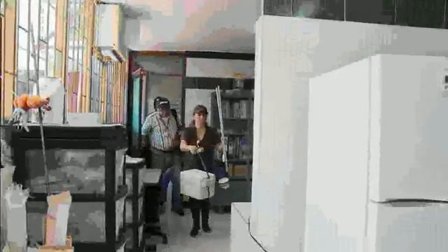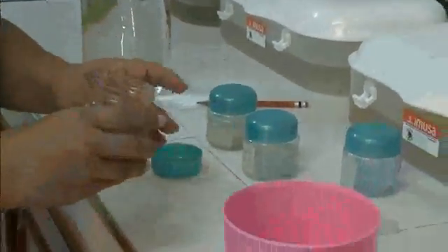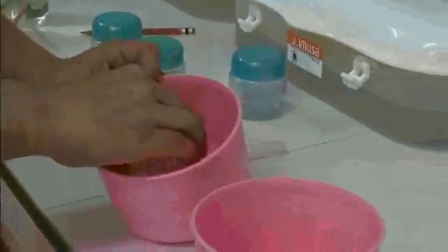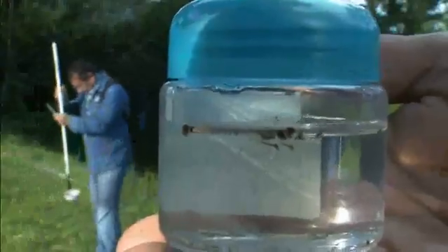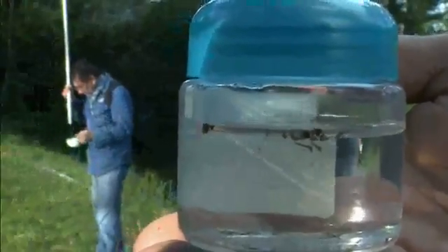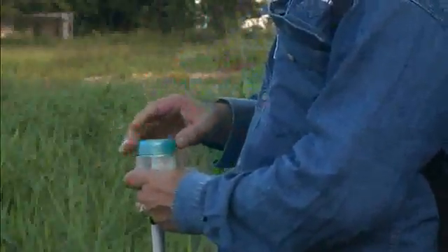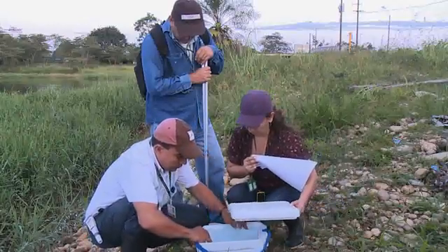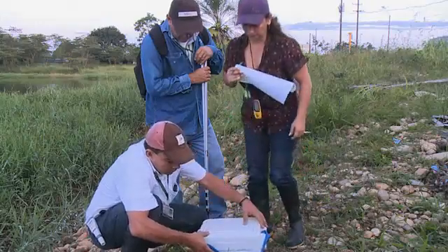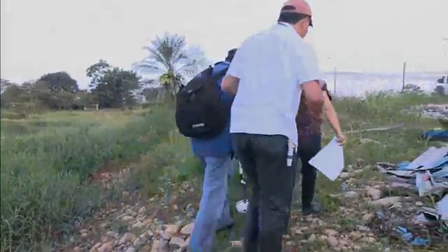Since additional tests may be conducted at a laboratory, larvae and pupae should arrive alive and undamaged. Larvae should be transported in a container with water from the breeding site. Make sure an appropriate amount of air is at the top of the collection bottles so that larvae and pupae can breathe for a few hours. If the journey to the laboratory takes more than 2 to 3 hours, remove the lids of containers every 2 hours to provide the specimens with fresh air. Avoid direct sunlight and excessive shaking. Pack bottles carefully so that they are not jolted during transportation to the lab.